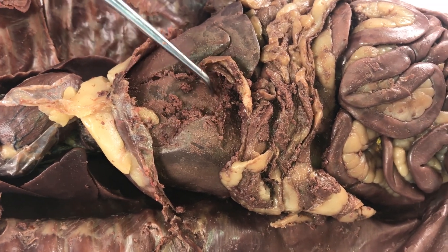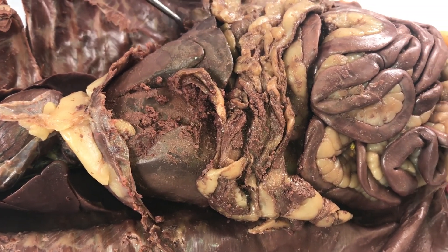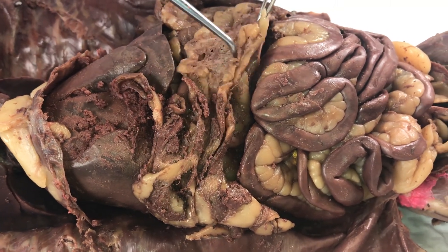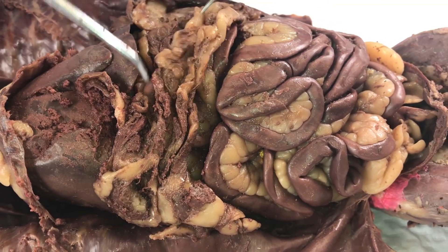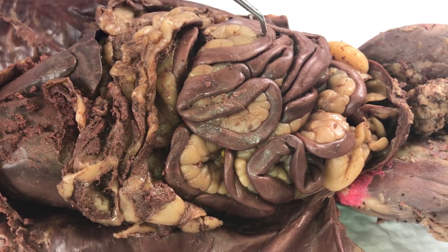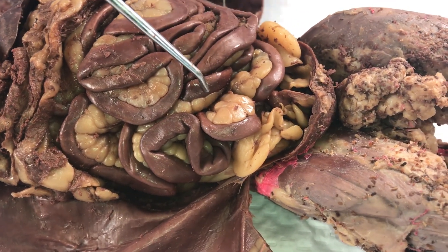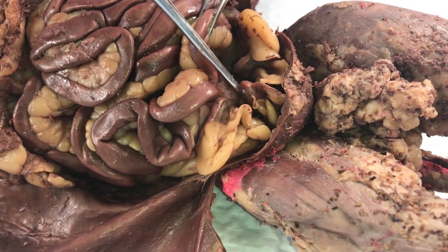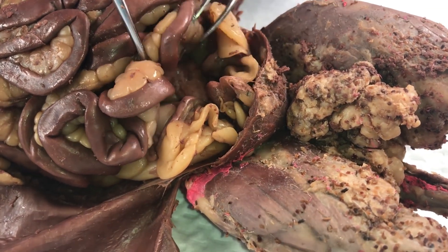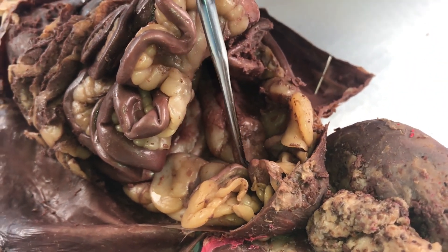You can also see the lobes of the liver. Here's the greater omentum that covers the small intestines. You can see the small intestines, which take up a great portion of the abdominal cavity. Here's the urinary bladder. Moving the small intestines out of the way, you can see the large intestine and the colon.